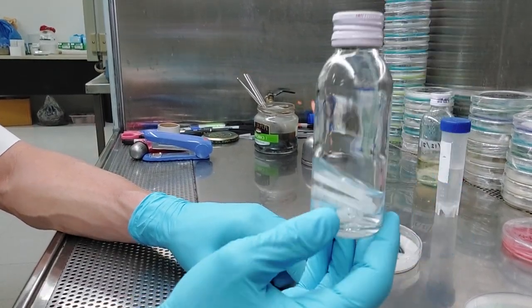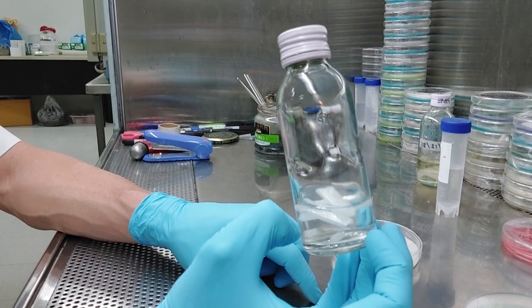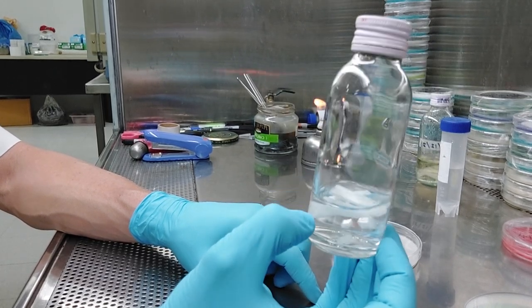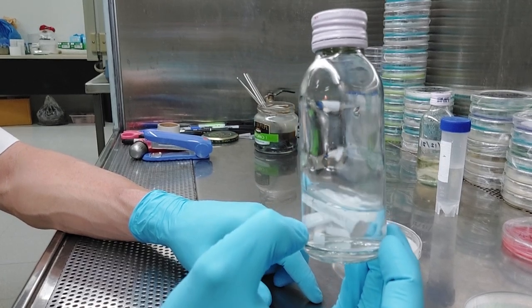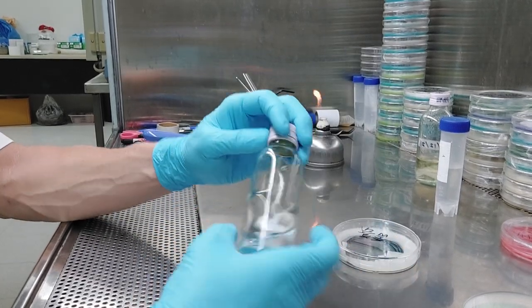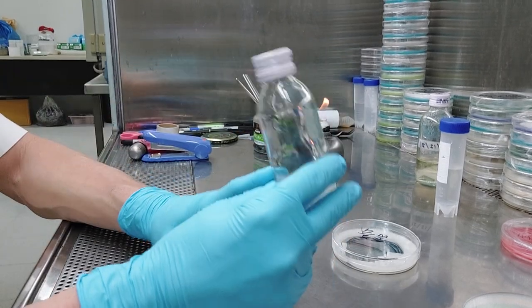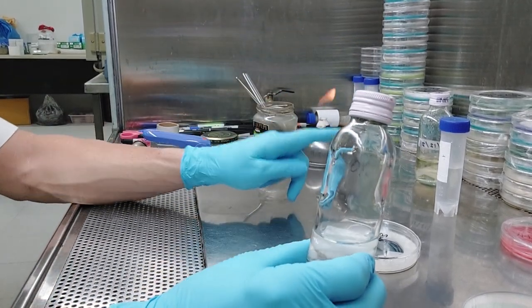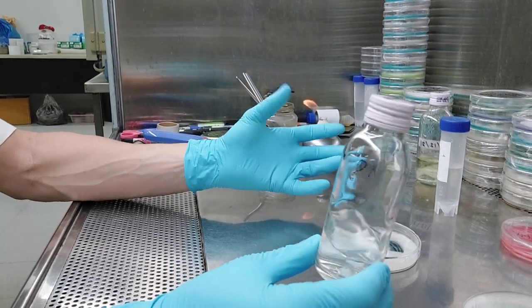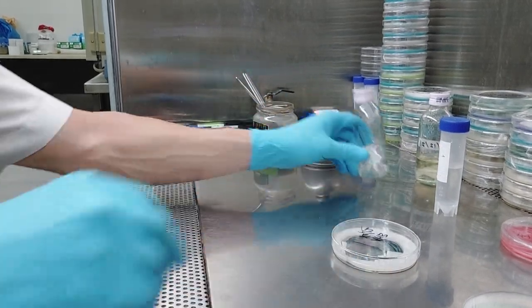If something is wrong, just like LC, if something's wrong, it's wrong already. Right? So it doesn't matter for one of those strips. You do not want to introduce anything in here. If a single bacterium gets in there, that whole thing is screwed, you guys. I've spent months and lots of time and lots of plates trying to clean up agar or LC that's contaminated. You do not want to do it. Do it right the first time. Make sure your water's sterile. Make sure your container's sterile. Make sure you adequately follow aseptic technique.